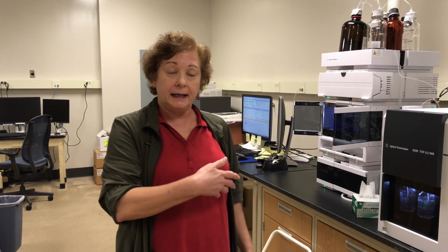If you decide that you want to become a user, I can train you to run the instrument yourself. I can also train you to look at your own data, so that for any instrument that you have to use now or in the future, you would be able to interpret your own data, and this is very valuable.